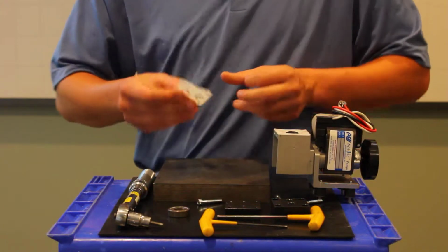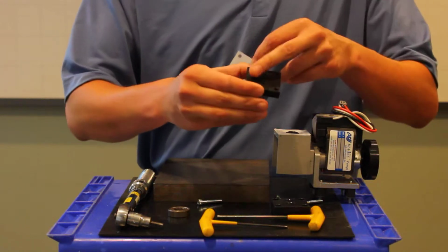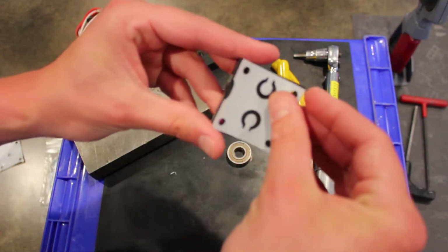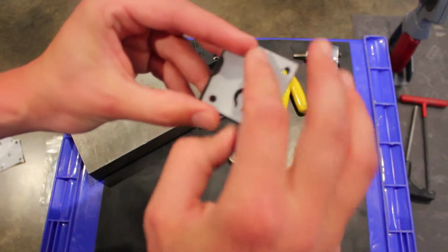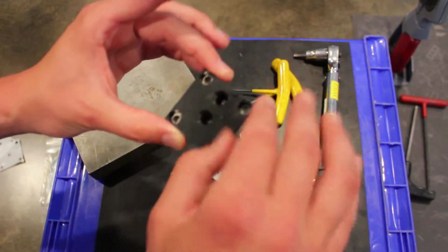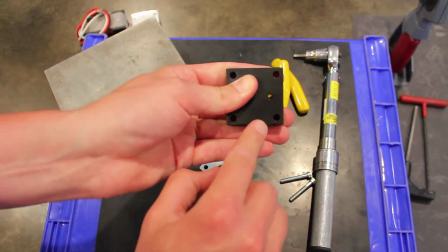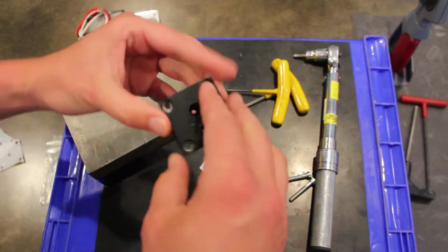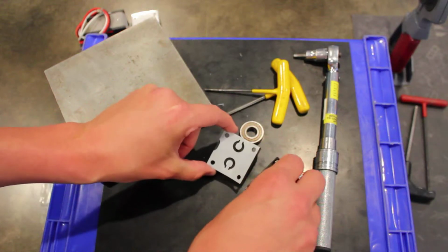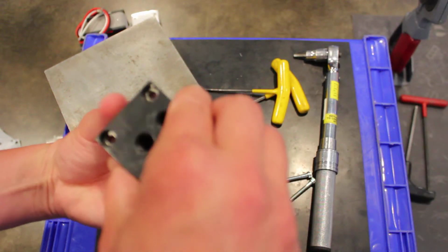Okay, so now we've got our nice flattened gasket, and we'll take our valve body, which has a small little slot right here in the side, which of course the gasket also has. So what we want to do is line up those slots so they're in alignment. Then we want to grab our head, keeping it upright so we don't lose our 4 lock washers, and it's also got a slot right there on the side. So we'll go ahead and find the slot, and we'll align it right on top of the valve body on the slot like so, making sure that we don't press or pinch any of the valves.